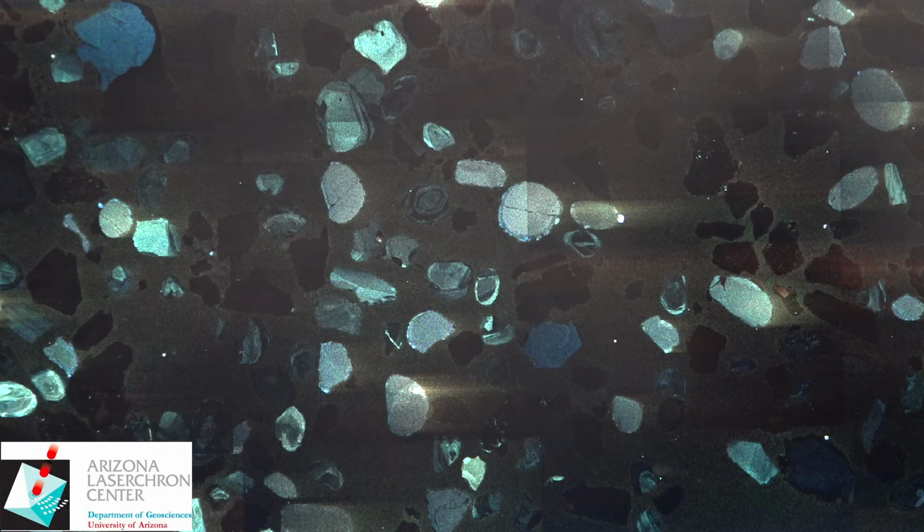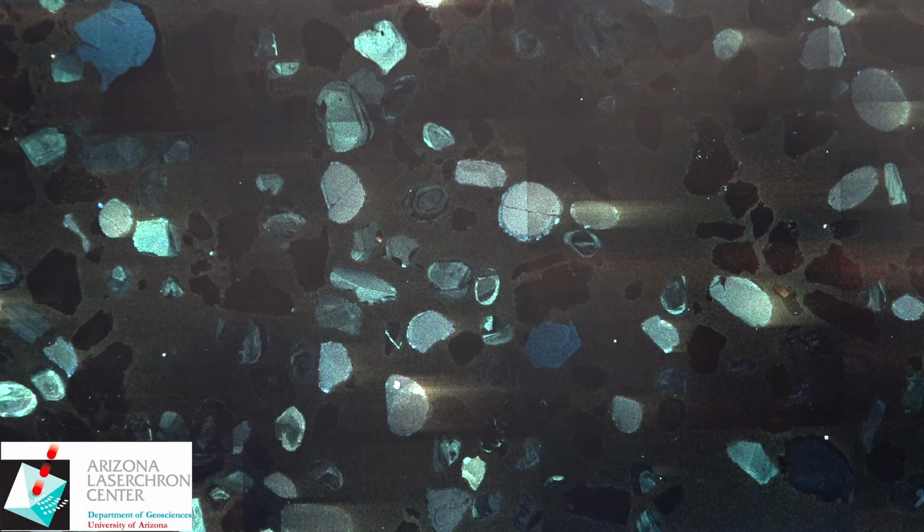One thing you may notice in this image as well are these large orange streaks. These are very typical of an apatite grain when it is CL'd. So it will fluoresce the same color as zircon, more or less. It'll be blue or this hint of a yellow-green, but it will have this tail of an orange streak, which occurs because of the phosphorus concentration inside of the apatite crystal.